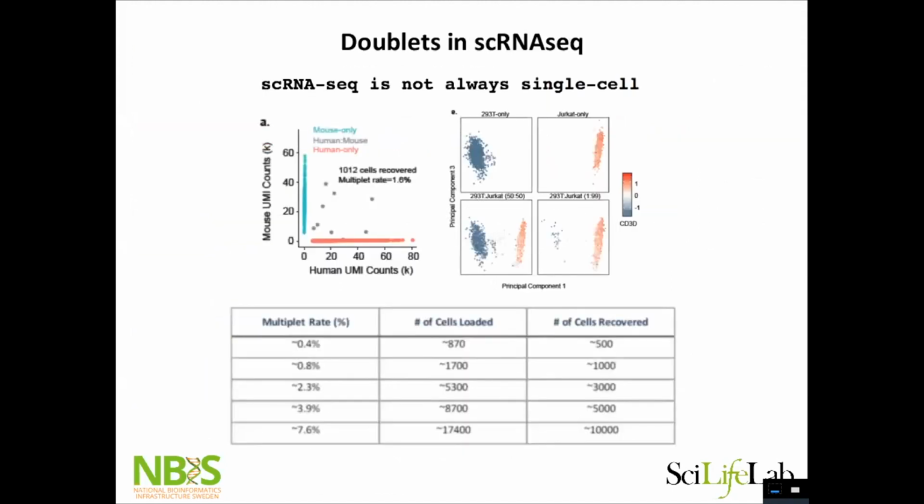So I think you're all aware of doublets, right? In 10x, there have been some experiments mixing different species and also with cell hashing. So you always get here, we have the human cells and the mouse cells. And then we have some cells that have reads from both species, or a mixing of different cell types, where you do have some cells in the middle.